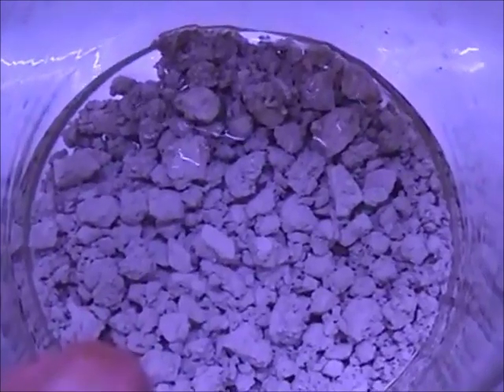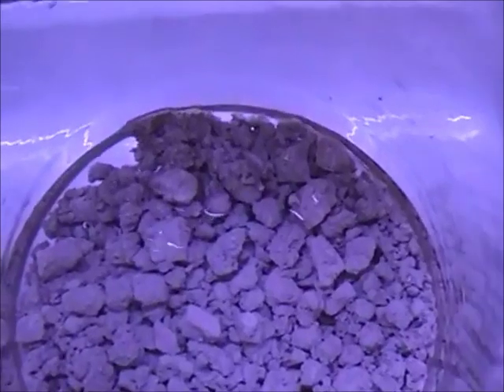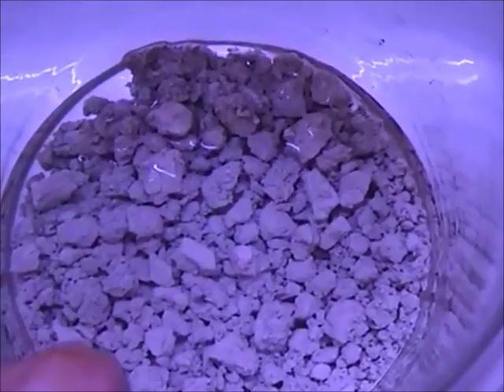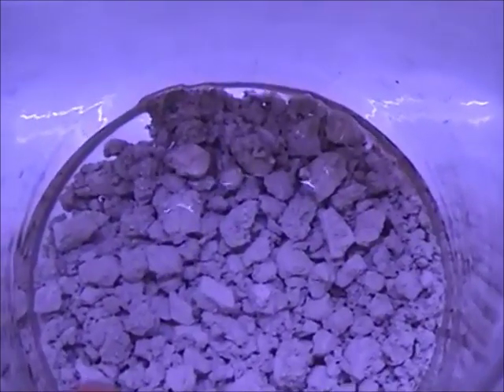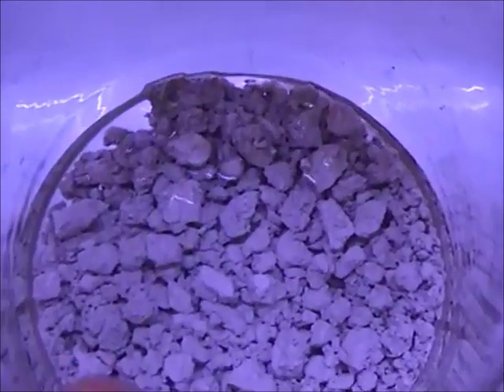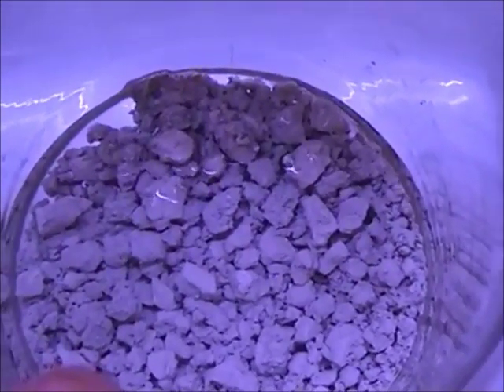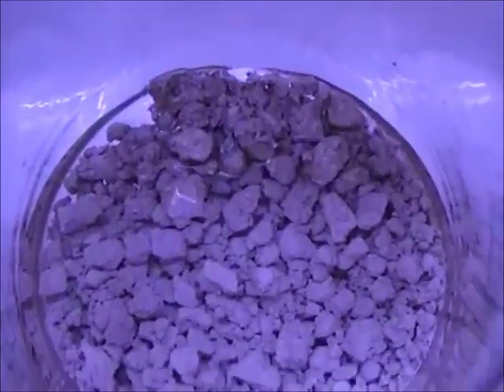I noticed there wasn't much copper trapped in the solution inside of the silver. I've already boiled this for about an hour last night trying to clean it up, because we're going to be sending this off for some tests later to see what our purity of our silver is. Just like with gold that's real clean in a powdery form, it will tend to clump up and form little balls, and that's an indication of our purity.